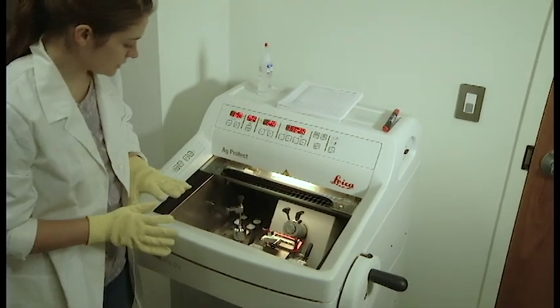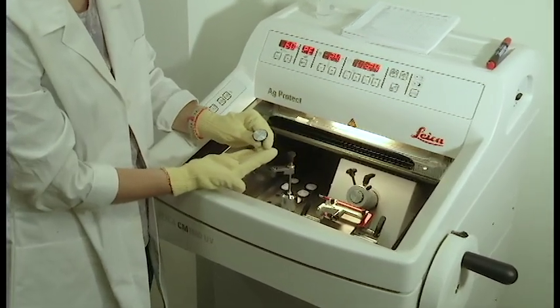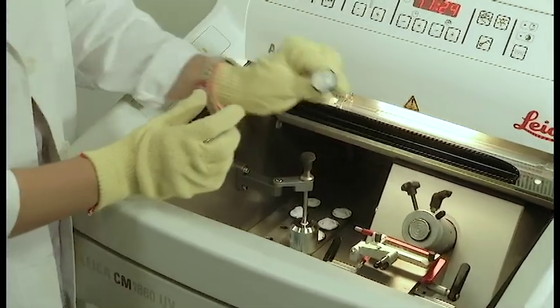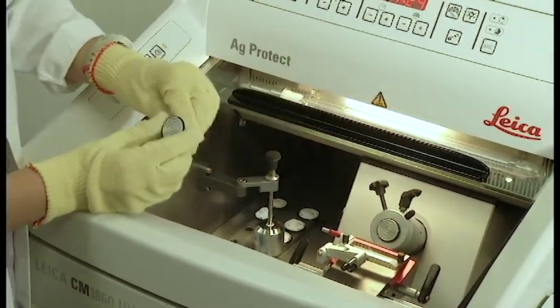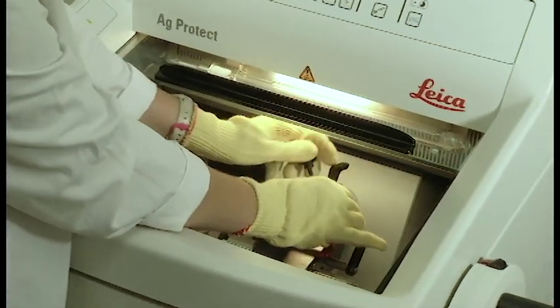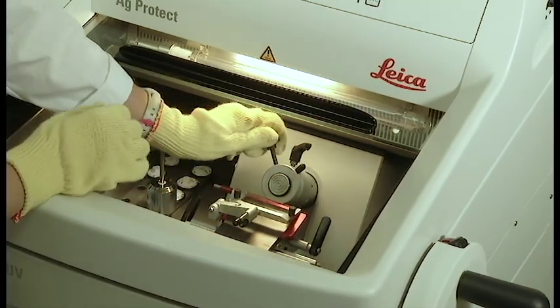So moving inside the machine, we have our specimen disks. This is where you're going to place your medium and it's what's going to be placed inside of your mounting area. Over here is the mounting area and you simply place the disk inside and screw it to fasten.